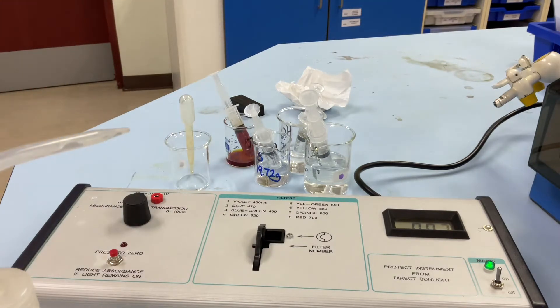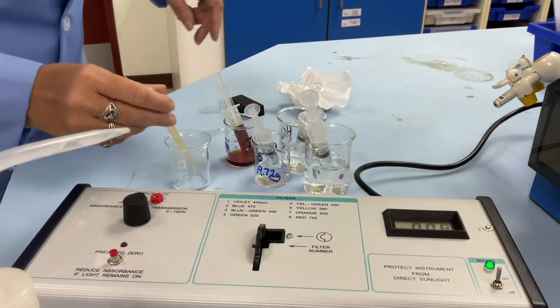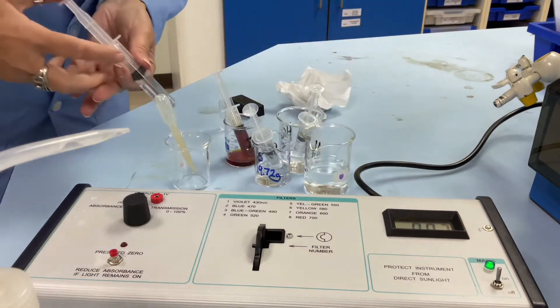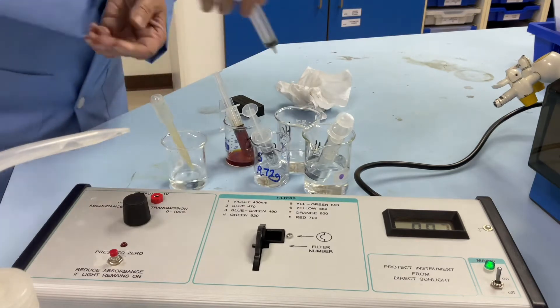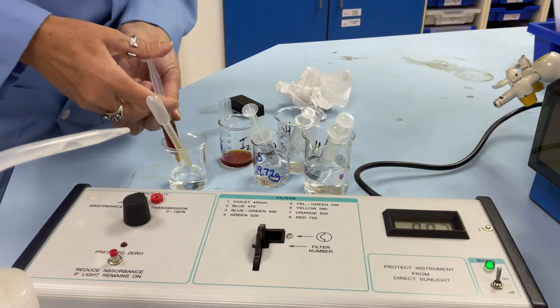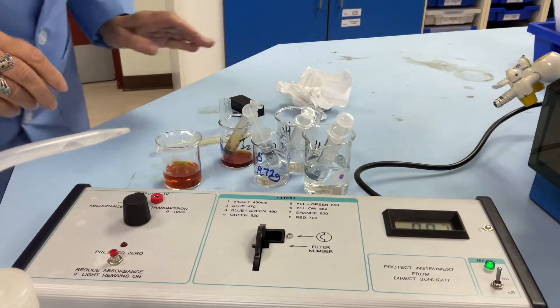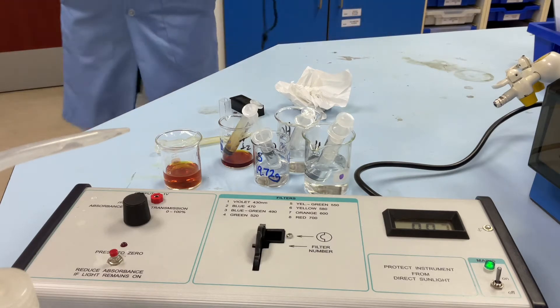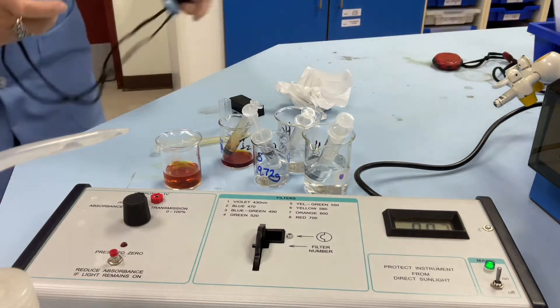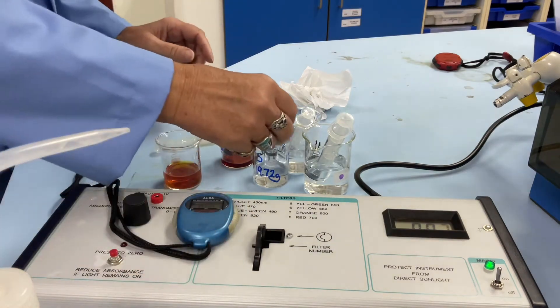I'm going to get rid of that and now mix my reagents up together. So I have to have eight mils of water, four mils of acid, four mils of iodine. And now I need a stopwatch. I'm going to start the stopwatch as soon as I put the propanone in.